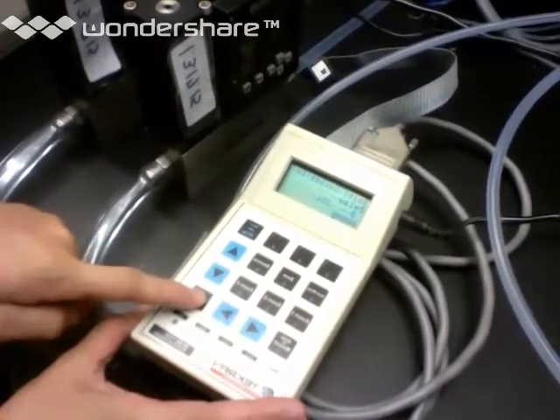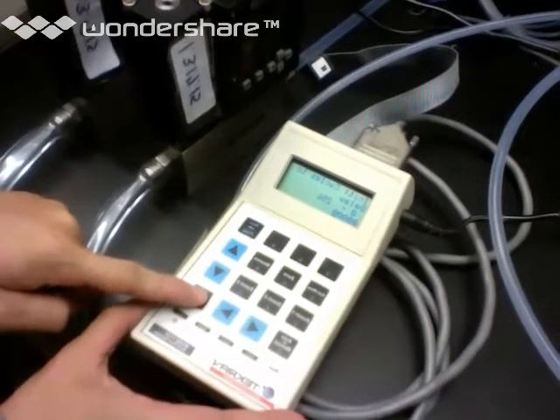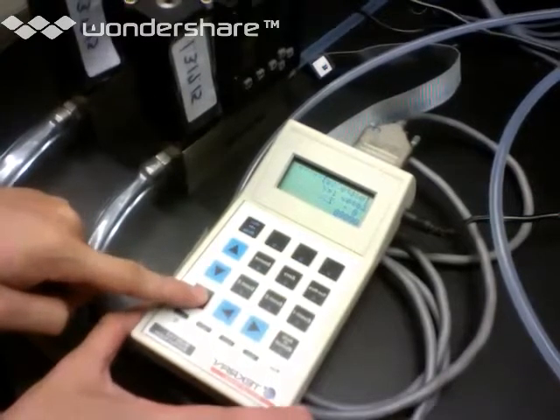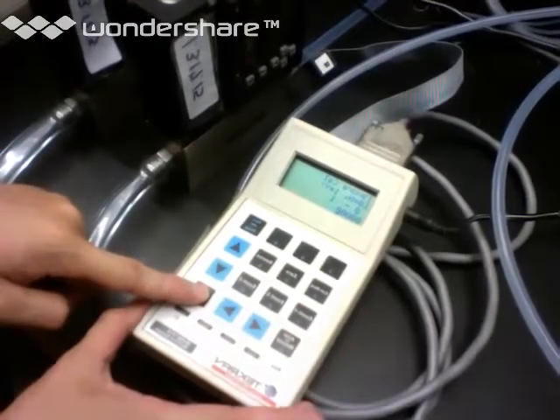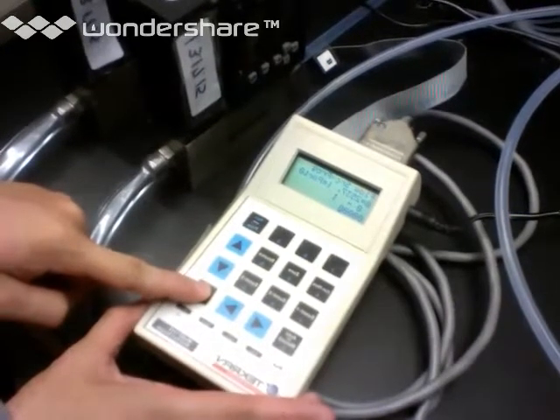Header parameters essentially let you label the ports. Initial delay cycles are just the initial clean cycles that you can run. I'm leaving it 0. That's fine. You don't want to ignore the calibration because it's going to be calibrating. Full source programming.